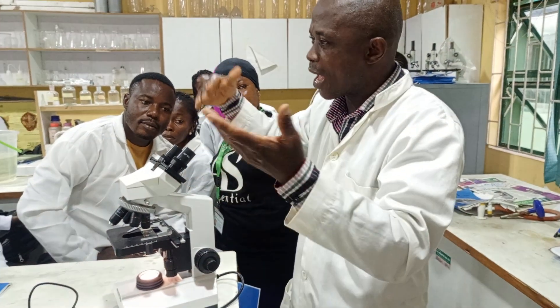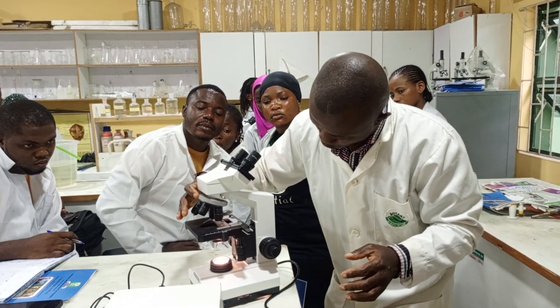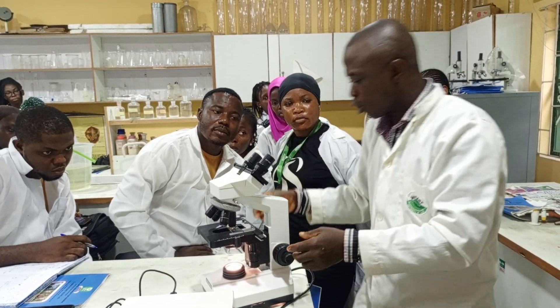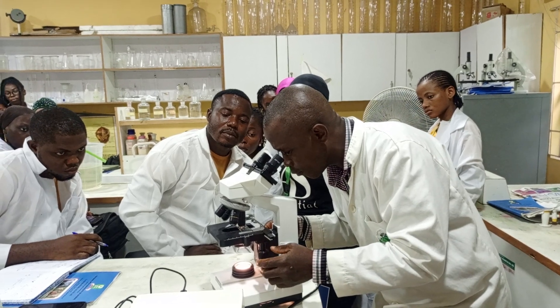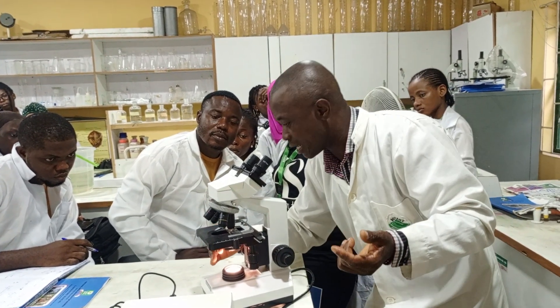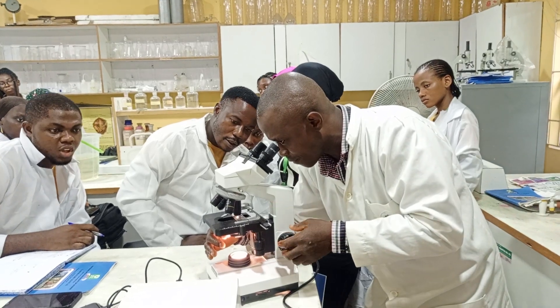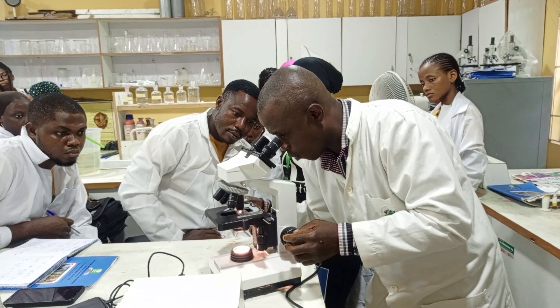If you want to go to higher magnification, use the revolving nosepiece to move to times 40. Then do not touch the coarse adjustment again — it will lose focus. Just touch the fine adjustment knob to get a fine focus. Because you are now using times 40, you need to increase the light since it's a bit dark, so increase the light from the iris diaphragm. You will notice an increase in the light, and then you have your perfect focus.